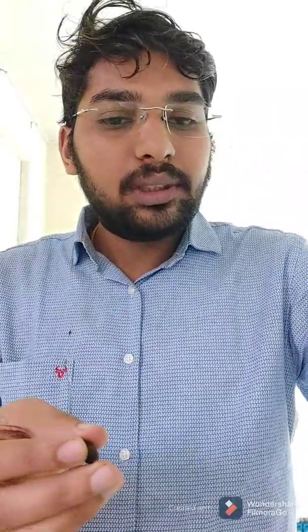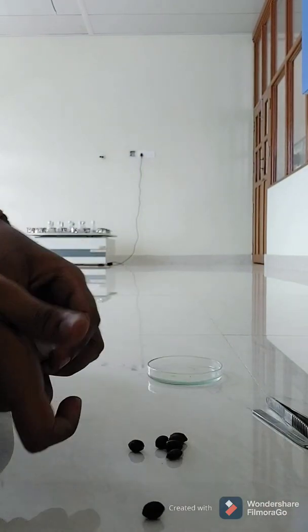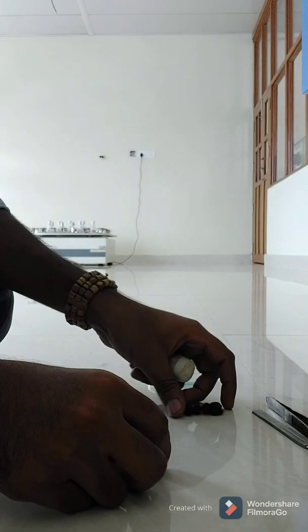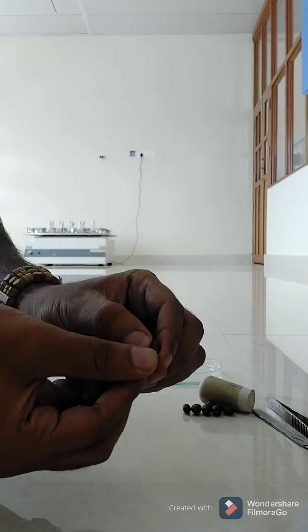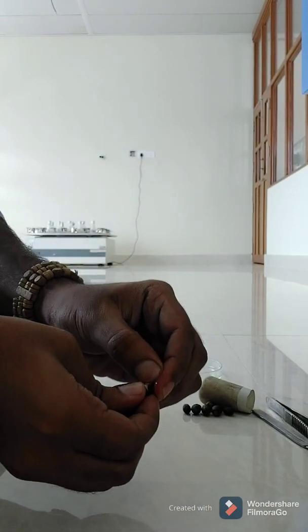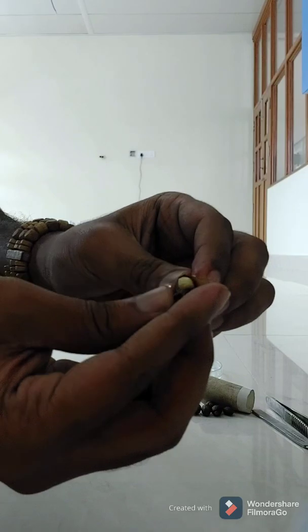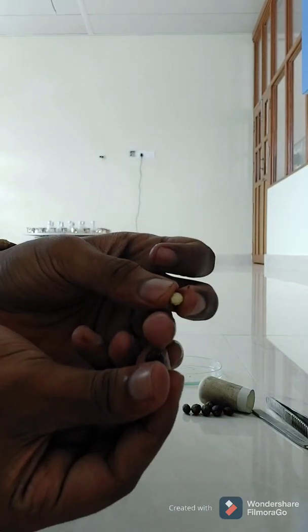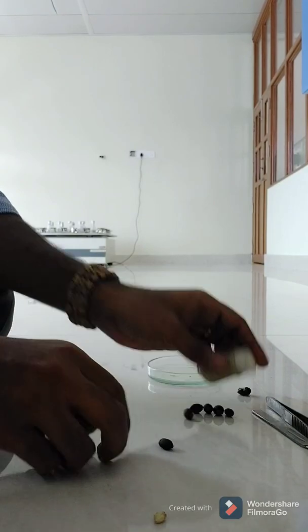This particular fruit has a very thick seed wall so I am going to use the pestle to break it open. I keep it on a hard surface and just hit it once — you should hear the crack sound. Now it becomes easy to break it open. I can take the fruit coat like this. You can see I have broken the fruit wall and taken the seed. This yellowish color is the seed. This has to undergo the surface sterilization process, so I will keep it in a conical flask and take it for sterilization.